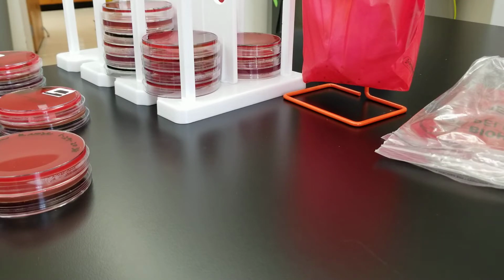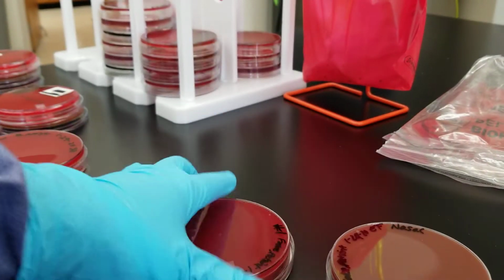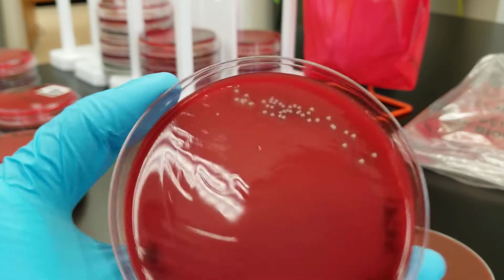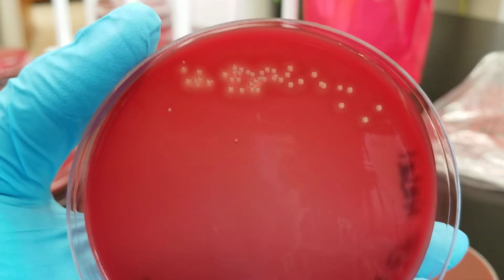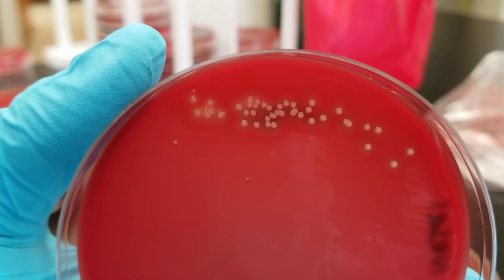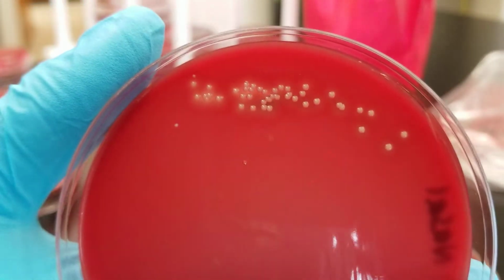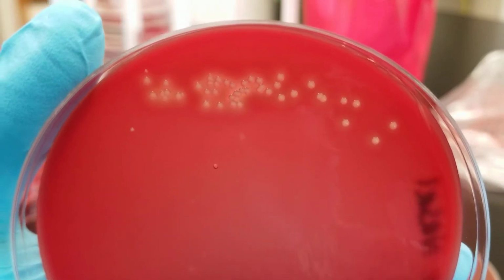Okay, I'm not going to go through every single body site and talk to you about that, but those are the main ones. But if it's normal flora in that spot and you notice that those are growing, that wouldn't be considered a pathogen. All right, so this is also a different person, a nasal swab. Notice that this is beta hemolytic, and you know that might be an issue.